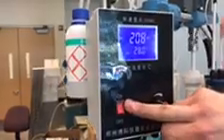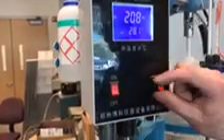So at any time that the pumps are turning on, we're going to turn this agitator back on up here. At this point, we leave this on all the time, so now it is in automatic mode. We can set our RPM, and we're going to set it at about 200 RPM, right about there. So this agitator has a dual function. One, it needs to stir every hour, let's say, for 10 minutes. That 10-minute duration of on time is reset back to on anytime any pump comes on.